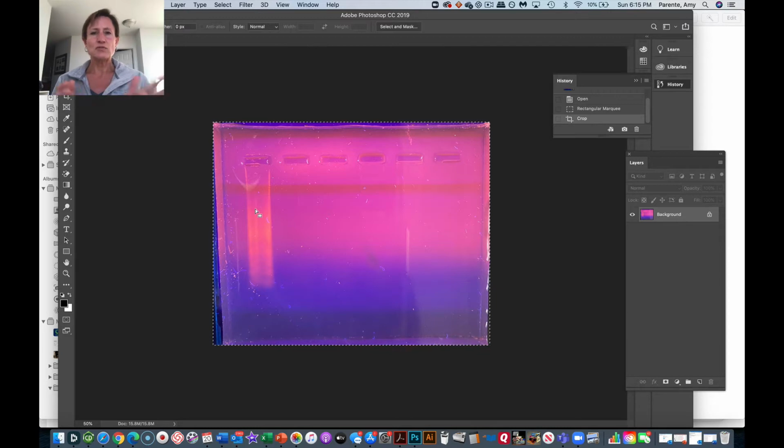That's going to be different from when we stain our protein gels. We're actually going to be using a cationic stain that is going to bind to the negatively charged protein, and it's going to show up blue. So that's just going to be a physical color. That will be a little bit different because it will be colored, but in that case, our protein is going to be the dark band against a light background.